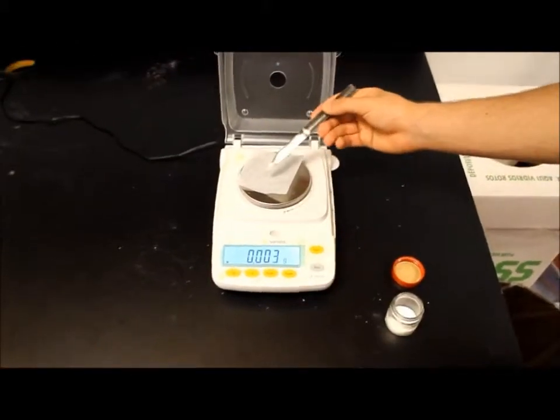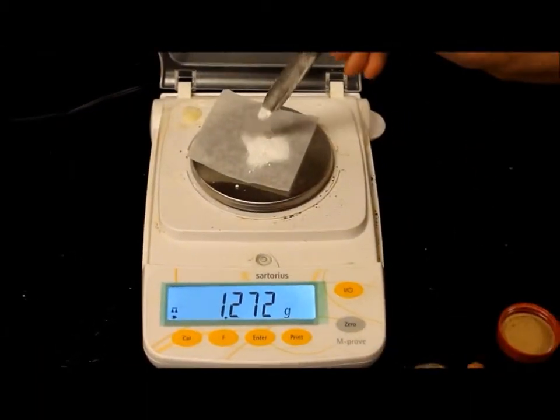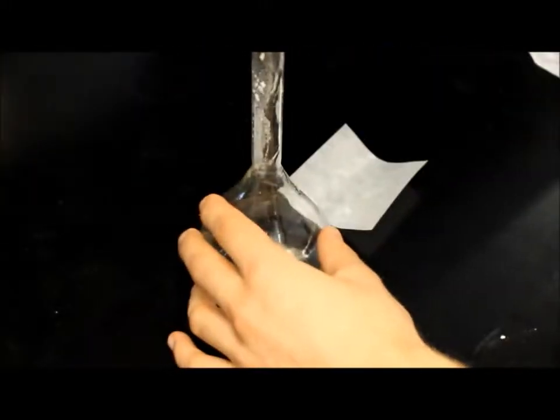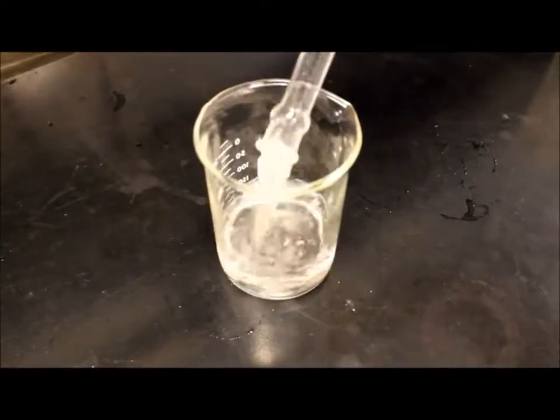Student A must weigh out approximately 1.3 grams of solid KIO3, record the mass, and add the sample to the 250 milliliter volumetric flask. Fill it to the line with distilled water to dissolve the solid, and transfer the solution to the 400 milliliter beaker. We now have an approximately 0.024 molar solution A.